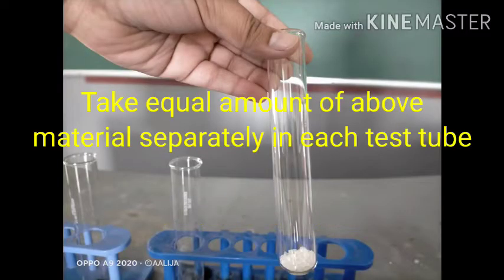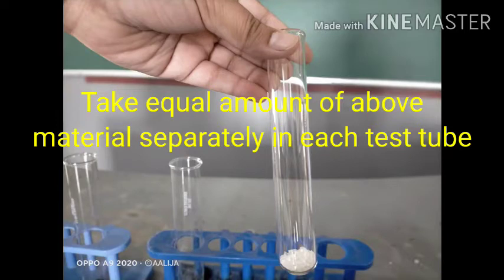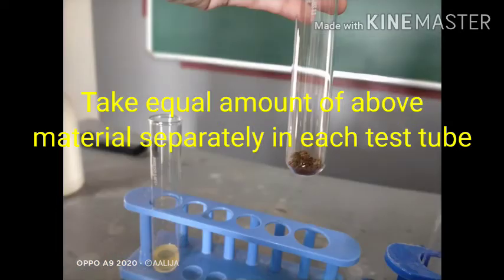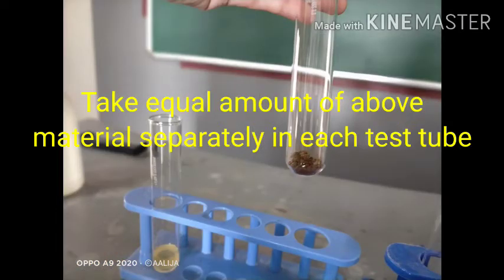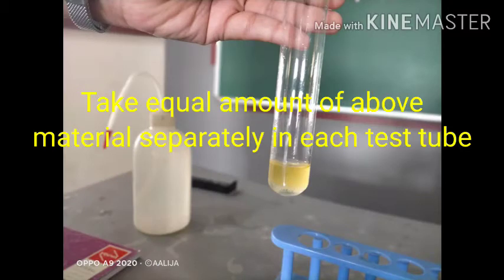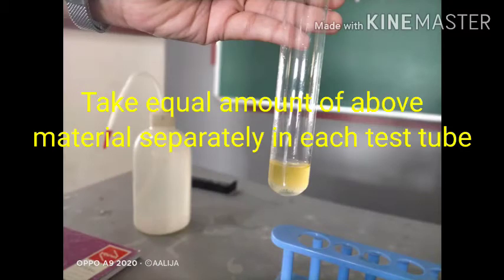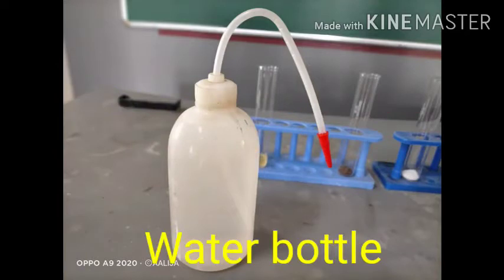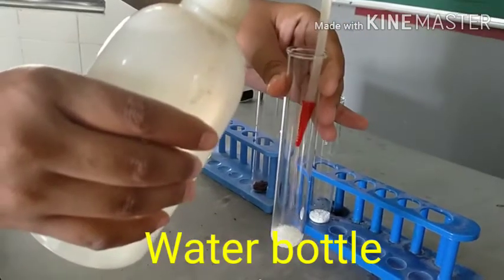Children, we need to take an equal amount of all the above materials separately in each test tube as shown here. You can observe properly — I have taken all the material separately in each test tube. Observe it carefully.